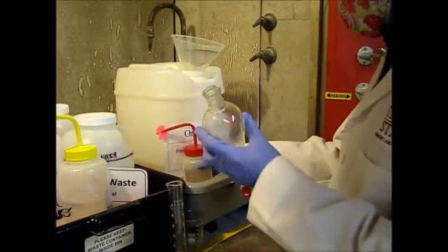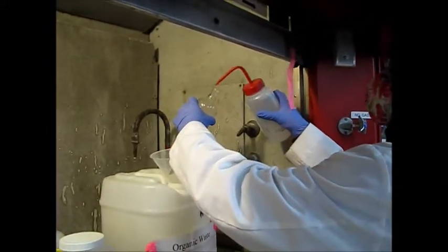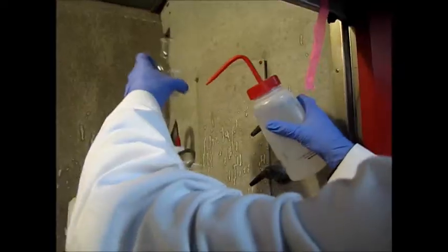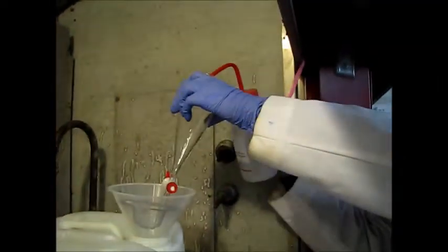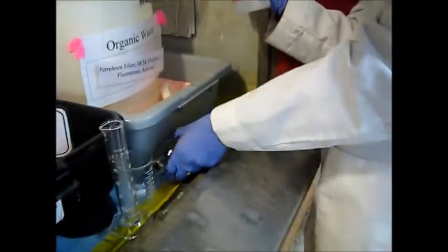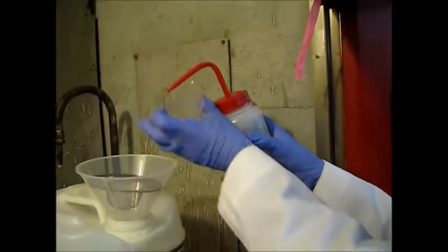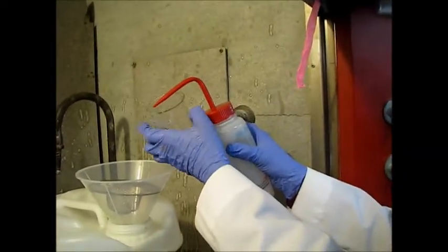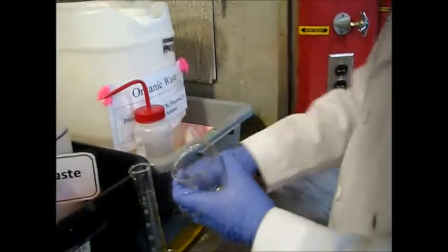Separatory funnel and all your glassware. So first rinse it with acetone so that you can remove all the organic solvent, organic compound from here. So you can see all the organic compound will be gone. And this we use for acid and base so there is no organic compound here.